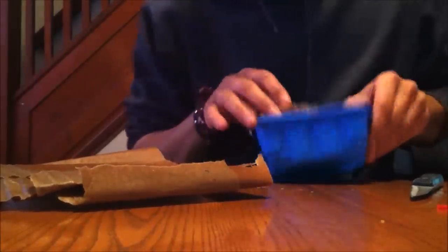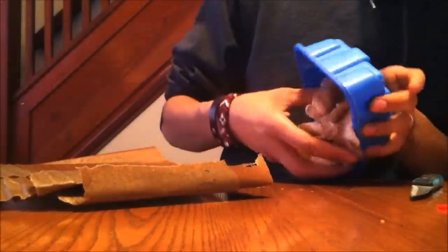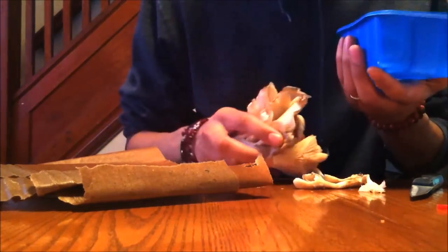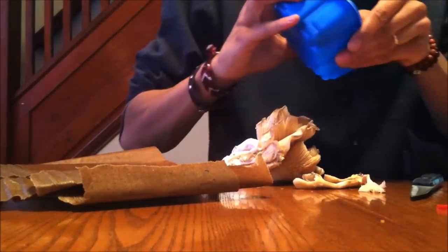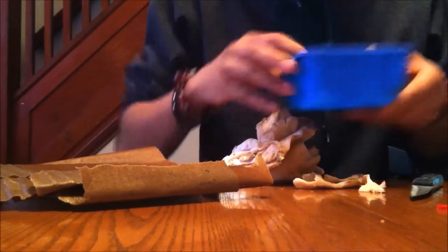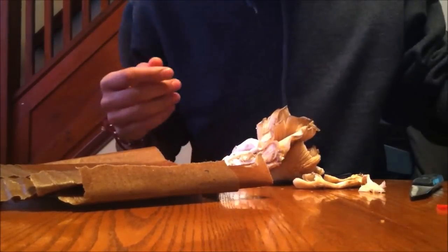Oyster mushrooms are very aggressive. I don't know what this is made out of, but there seems to be a little bit of mycelial growth on this blue thing. I think it's plastic. I'm not sure.